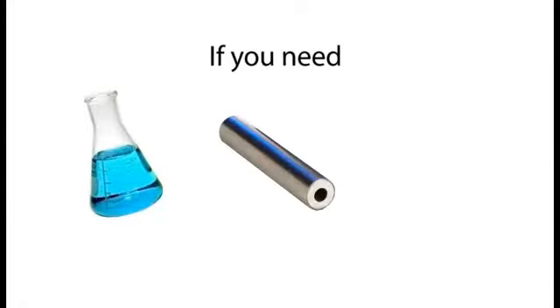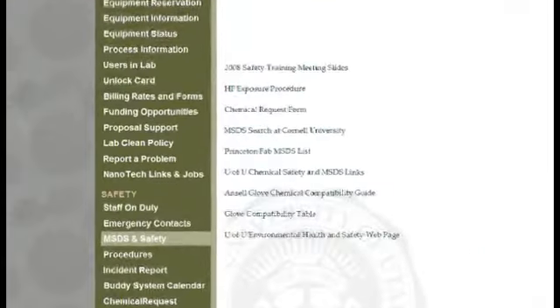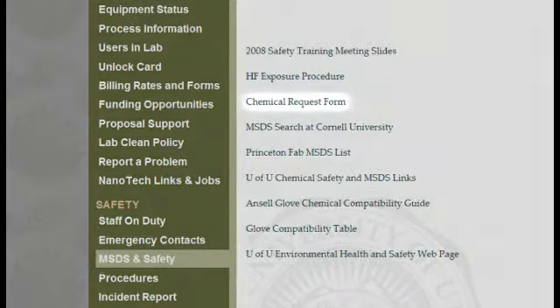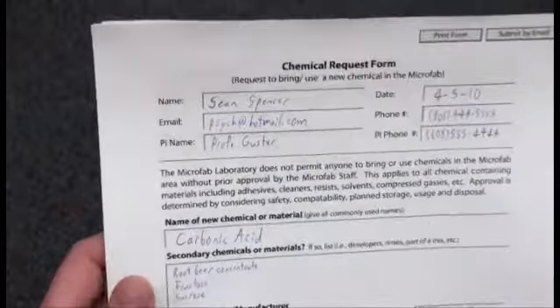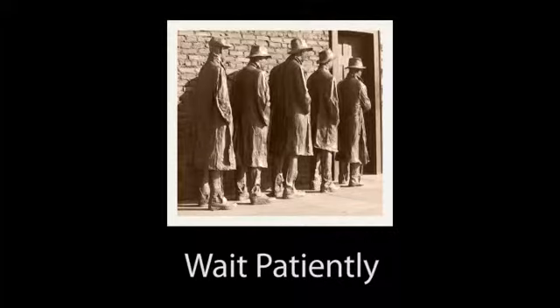If you need to bring in a specific chemical, material, or gas that is not currently available, then you are required to fill out the chemical request form located under the safety section on our website. We will ask questions about your processes, any potential safety hazards, disposal, and storage. You must attach the corresponding MSDS to the request form and then turn it into one of the lab staff. Wait patiently for approval before bringing any new substances into the fab.